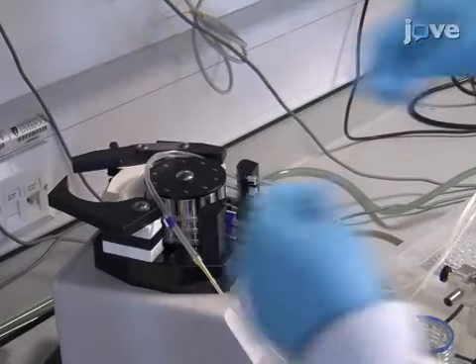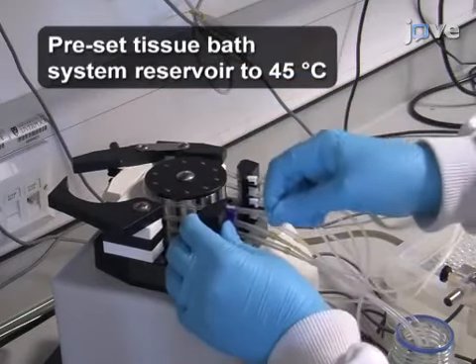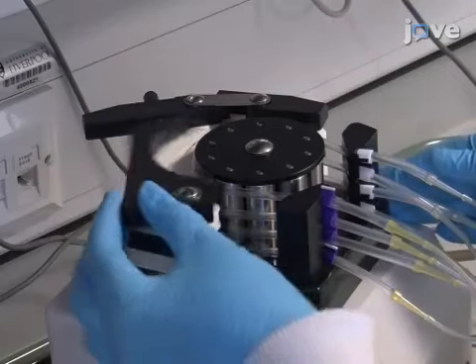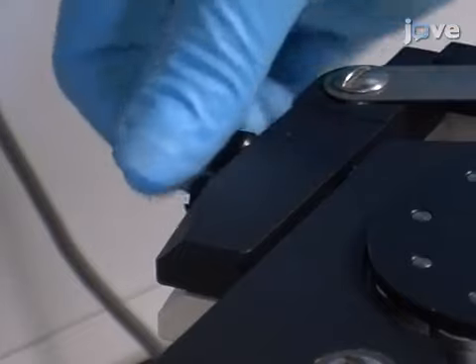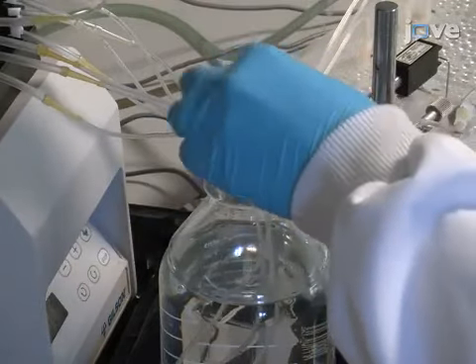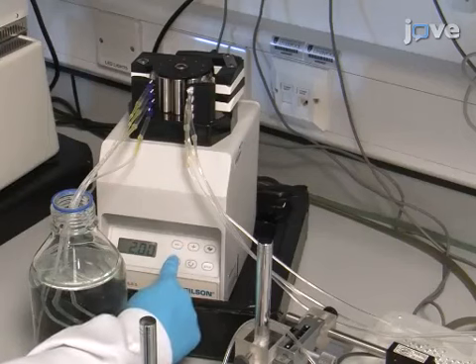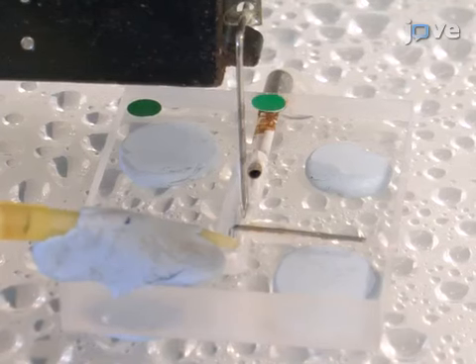Before beginning the procedure, position one peristaltic feeder tube per tissue bath around the rollers of the peristaltic pump head. Secure the tubes with the retaining stops by tightening the compression cams and locking the keys around the tubes. Place the free ends of the peristaltic feeder tubes into a 1-liter container of physiological saline, or PSS, and start the pump to allow the PSS to continually perfuse into the tissue baths.